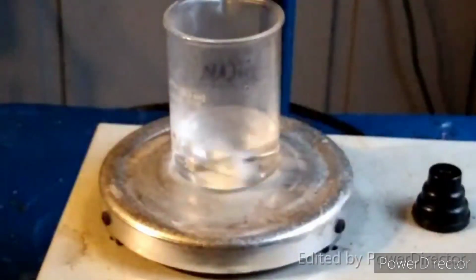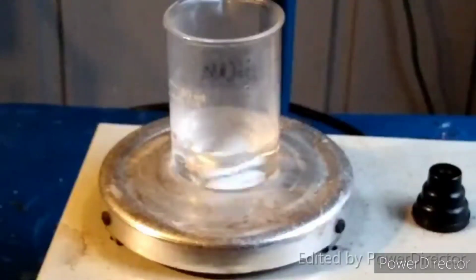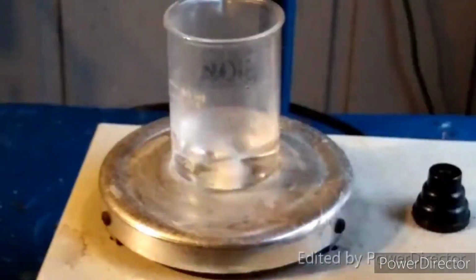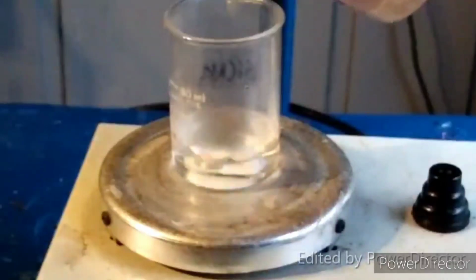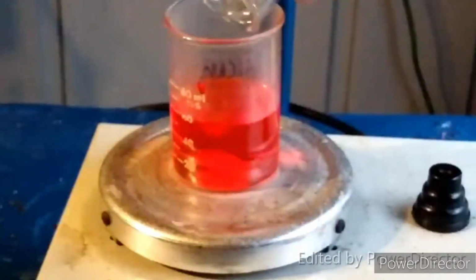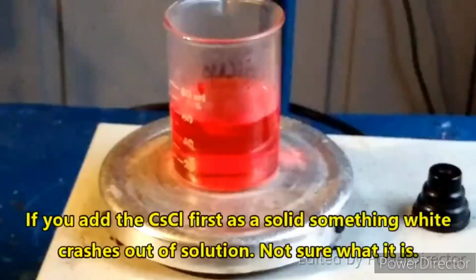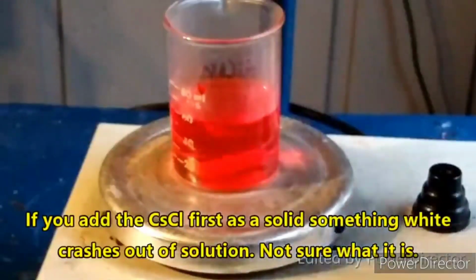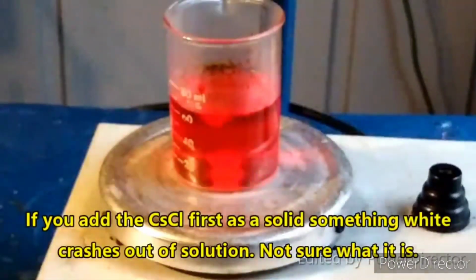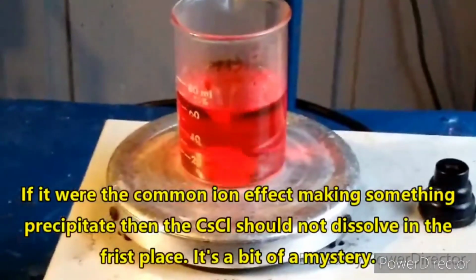Okay, now, the order in which you add these things, I think, makes a difference. I'm not 100% sure. We're about to find out. This is the potassium iodide. In theory, that should be potassium pentaiodobismuthate. Very pretty color, right? You focused, you piece of shit.